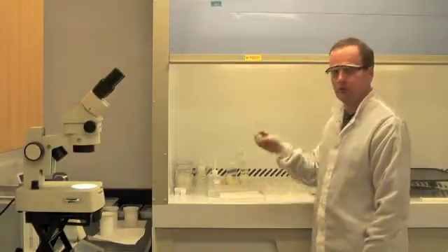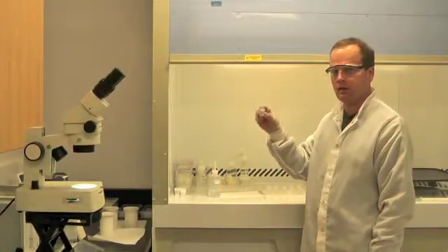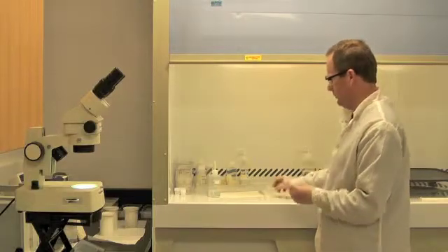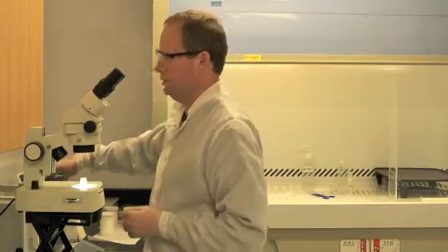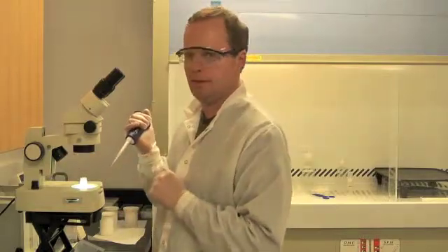I need to transfer the zircon, which is in water in this beaker, into the microcapsule for chemical abrasion. I'm going to do that under the microscope with a pipette that has a very narrow spaghetti tip.